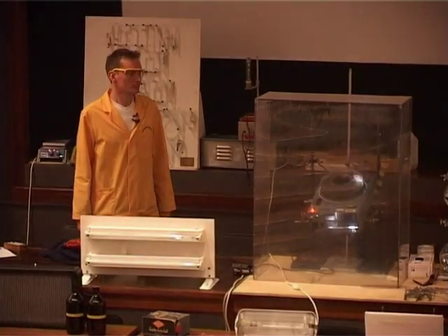Can you have the lights down, please? We have to be very careful here because the light, we hope, will set this reaction off.